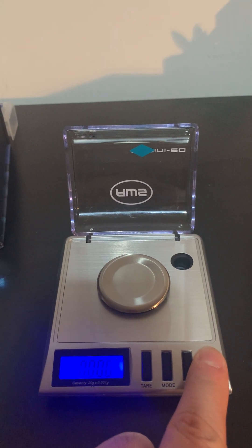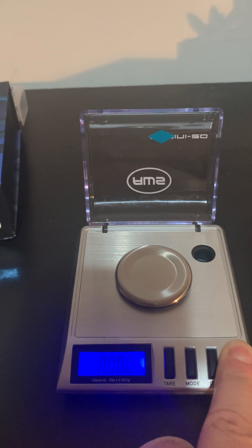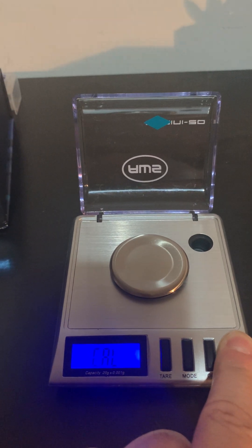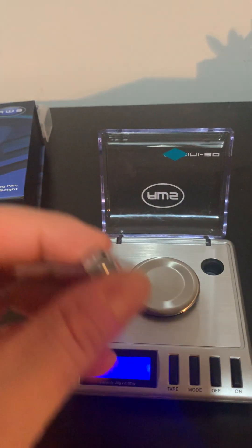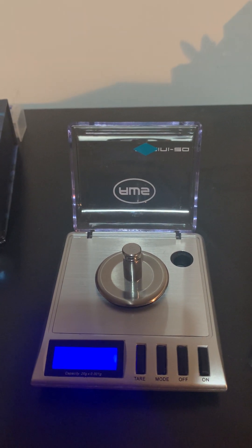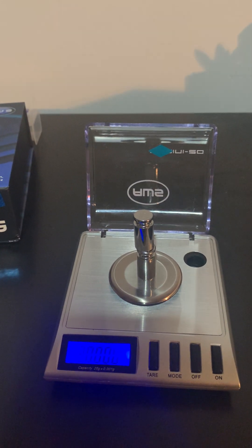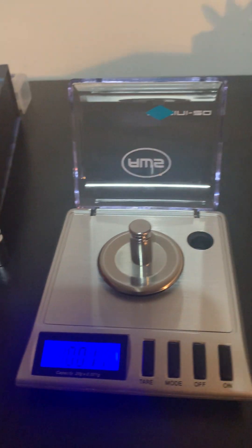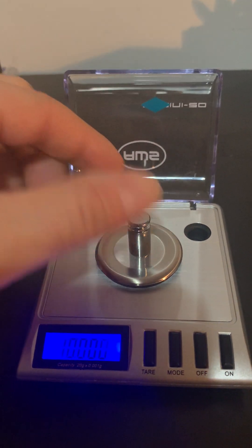So we're going to calibrate each and see what they do. To calibrate the Gemini 20, it's not too intuitive. You turn it on, then press the button a second time until it says Cal to calibrate, then press it down a third time until it says 10 grams. It calibrates at 10 grams first, then asks to calibrate at 20 grams — I usually just put the weight on top. It says pass, so I remove the weight. There we go — it goes down to 10 grams, which means it's calibrated.